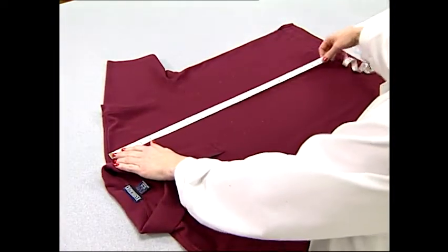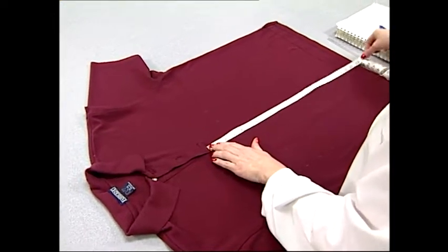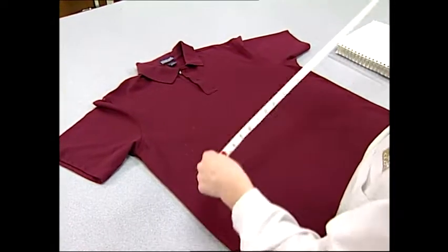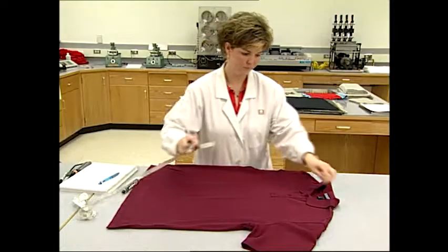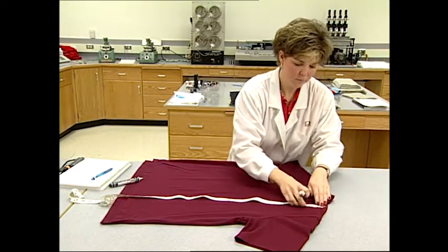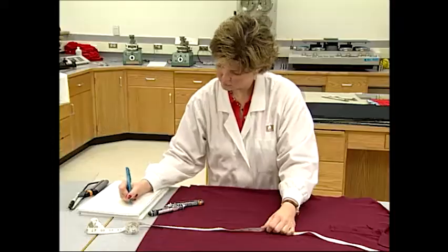Knit shirts are evaluated for shrinkage by using benchmarks and, in some cases, shrinkage squares. In the basic method, a knit shirt is laid on a table and all folds and wrinkles are carefully spread out with the front of the shirt facing up. The shirt is marked and measured at several locations before and after laundering. The benchmark for length shrinkage is determined by measuring from where the collar is sewn into the shirt at the junction of the shoulder seam, stretching a tape measure directly down to the bottom edge of the waist hem, and recording the length to the tenth of an inch.